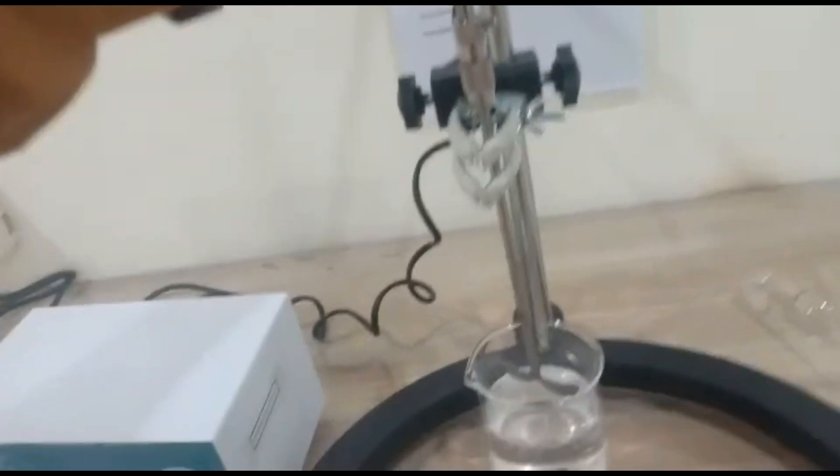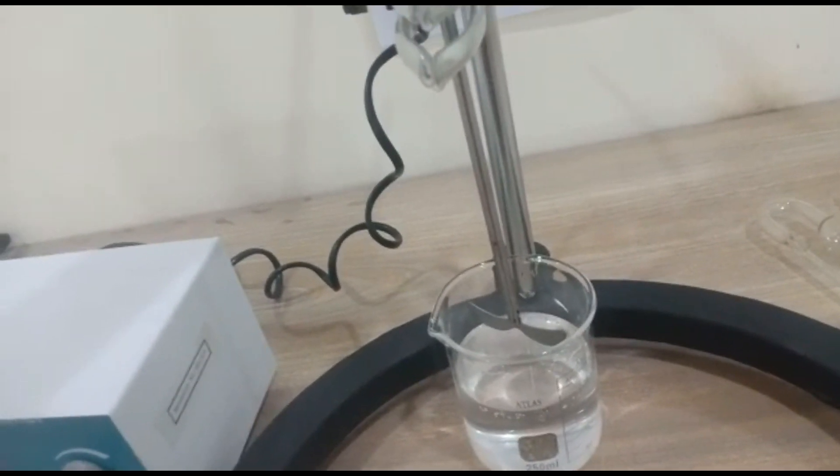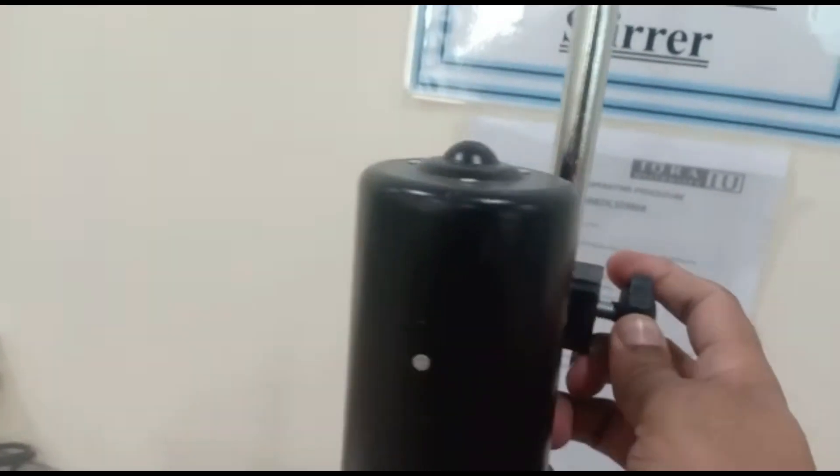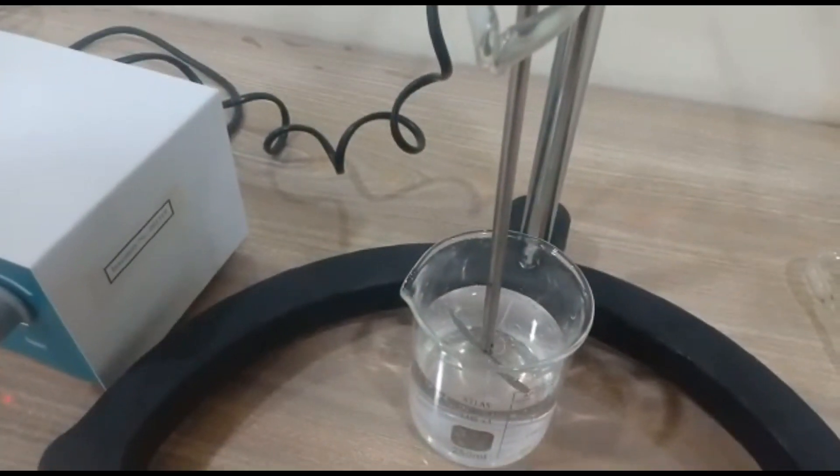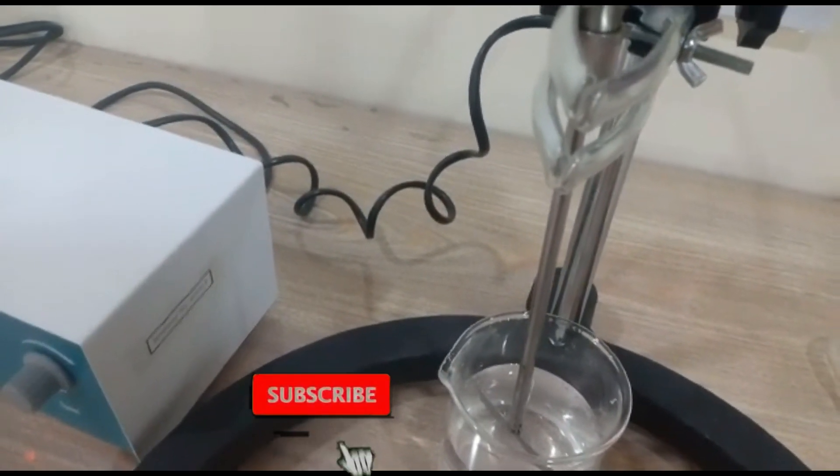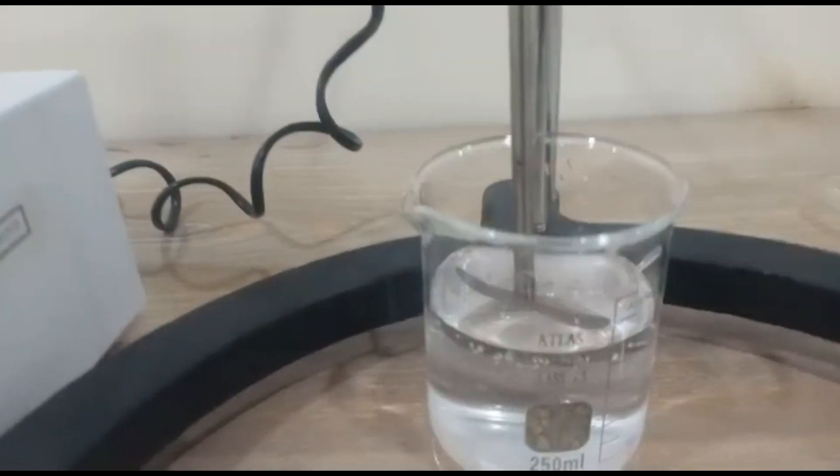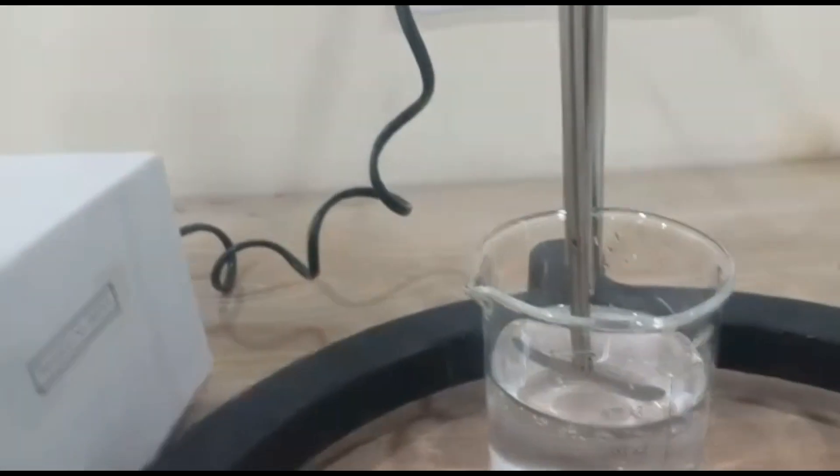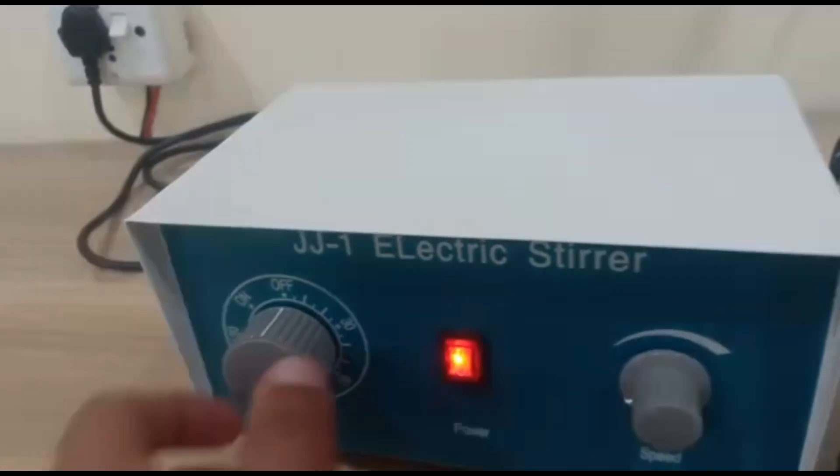We're looking at the back side. We adjust the position. You can open this knob to put the solution in or filter it out. Then move this up and position it properly on the right side.